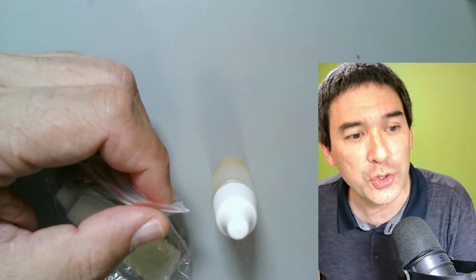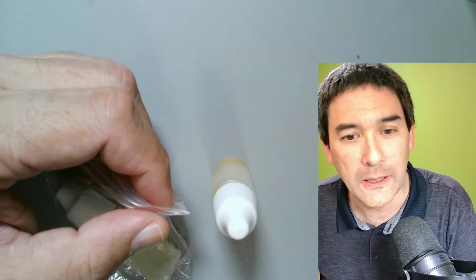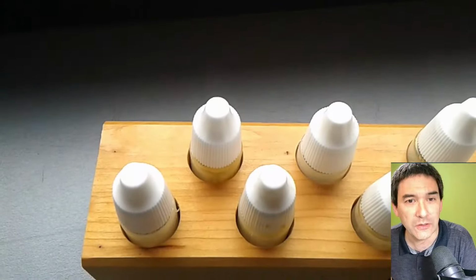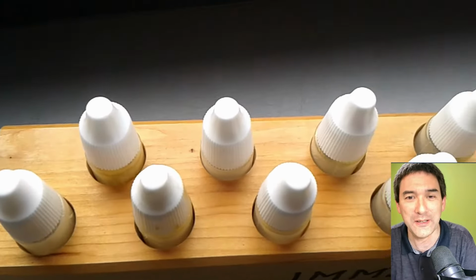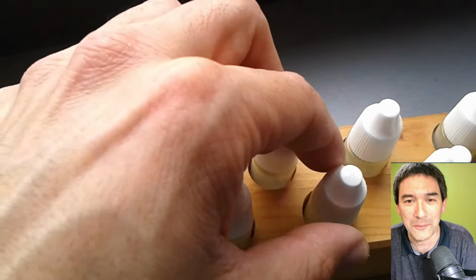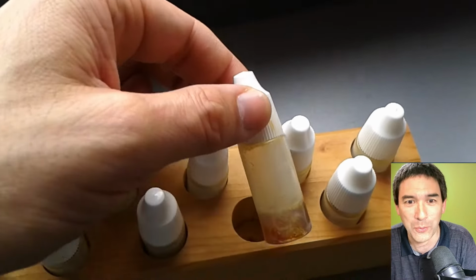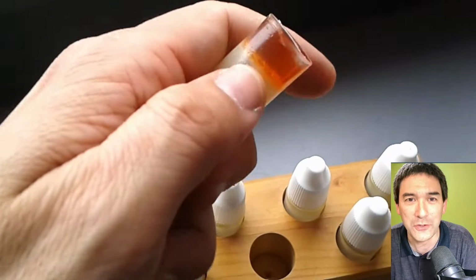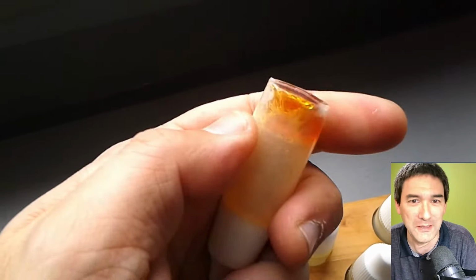I just want to show you a very quick video that I've made of a very badly solidified immersion oil. Just look at this here, okay? I pulled this out from my school, somewhere in the very back. I found totally new bottles of immersion oil, never used before, for maybe many years.